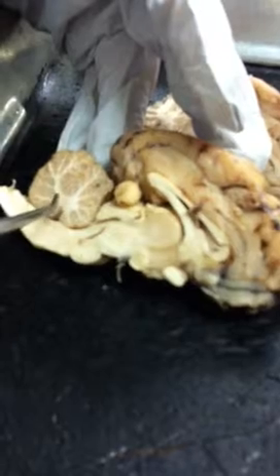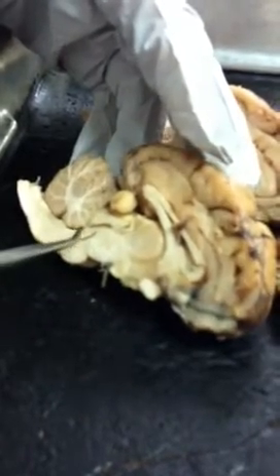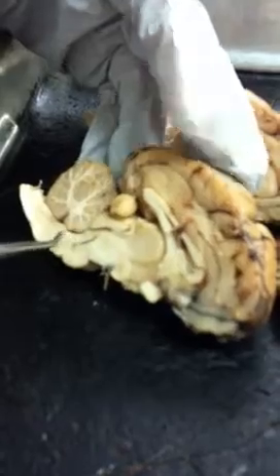This is the arbor vitae. Remember to point out the fourth ventricle? Where's that? Right there underneath the arbor. Oh, here? Yeah. So this would be the fourth ventricle here. Yeah, down there. That's the fourth ventricle. All right. So that's sheep brain.